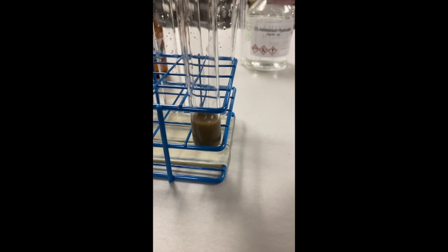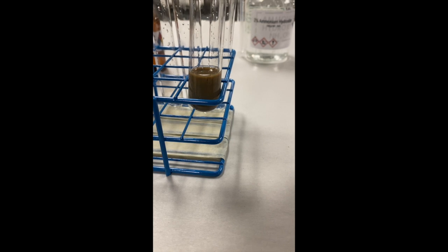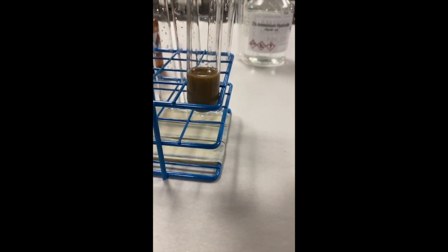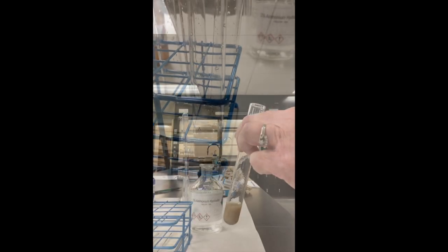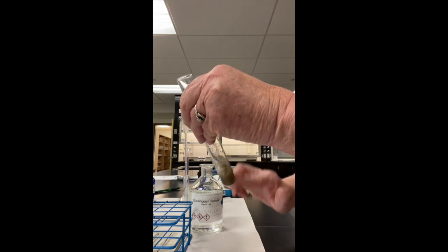So to make this easier to see I actually doubled the recipe, and right now I have in here silver nitrate and my sodium hydroxide. I'm going to go ahead and mix this. We have a dark precipitate going on in here.